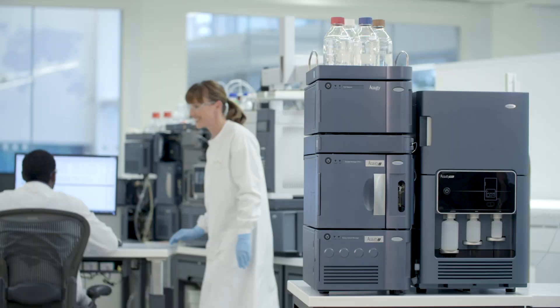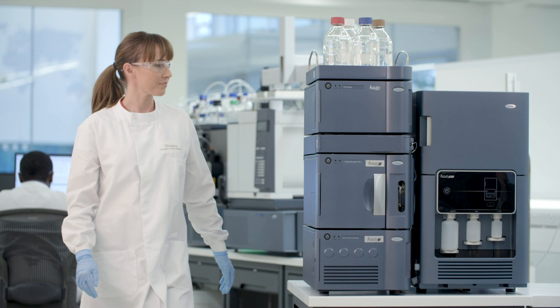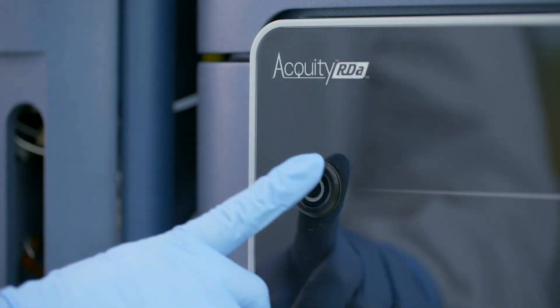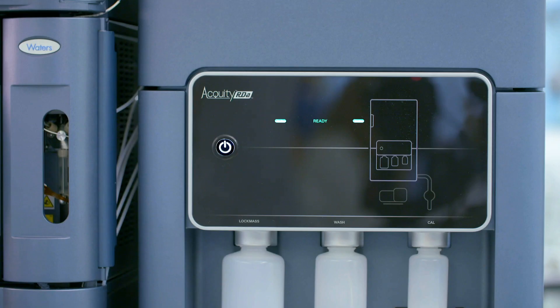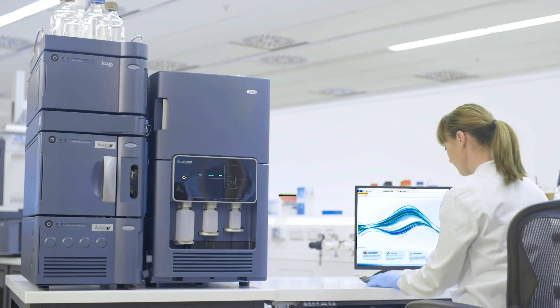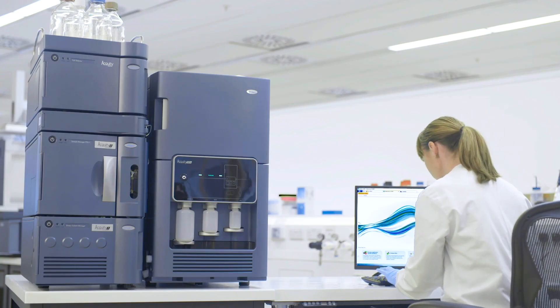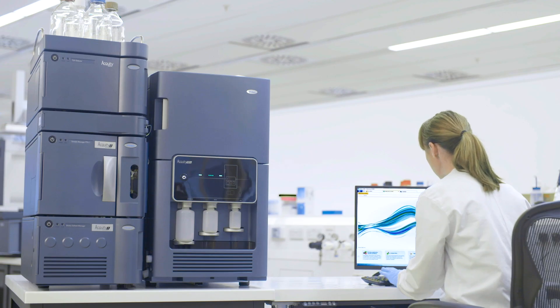The Smart MS Single Button Startup for resolution optimization and mass calibration simplifies the routine instrument setup that is often associated with time-of-flight systems, making it quicker and easier for users to begin running samples.